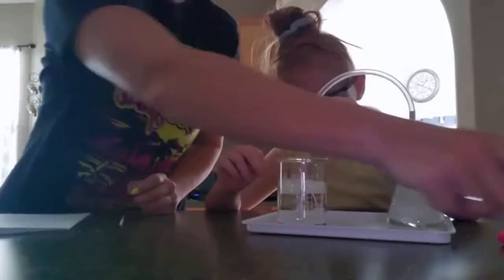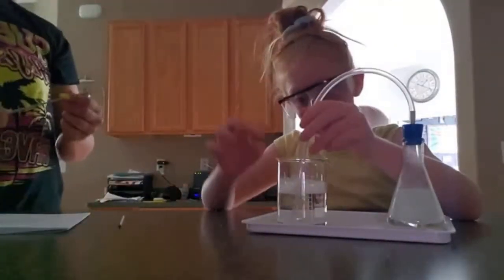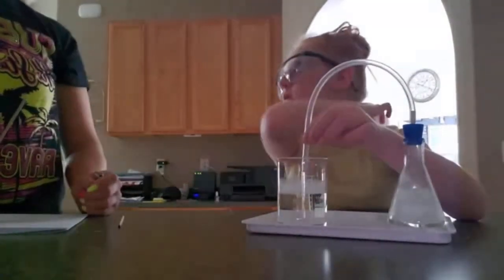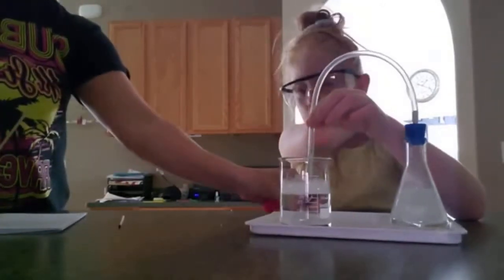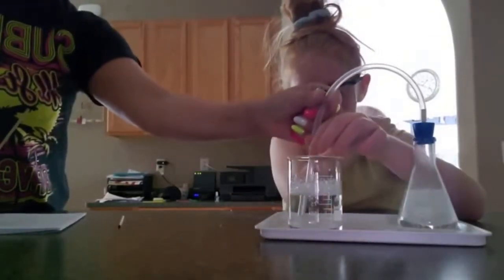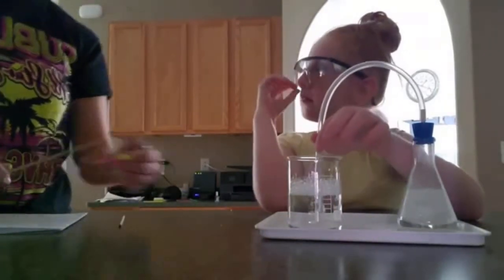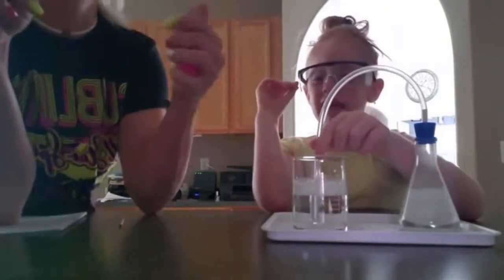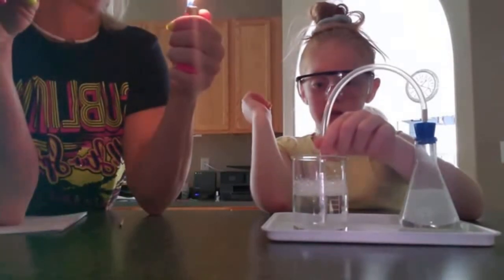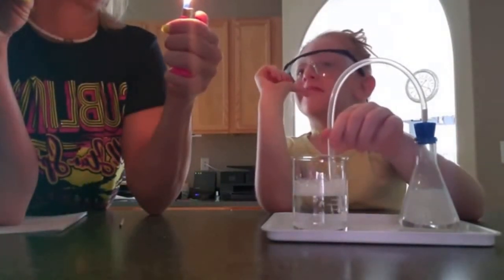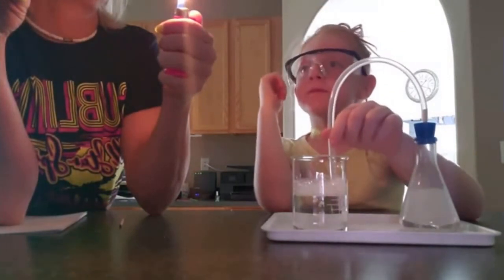What does it look like is starting to form on top of the water in our beaker? Foam! So when it's time for us to actually light it, Toby, you're gonna take the tube out, and it warns us we might hear like a noise, a pop or a bang. So let's listen and see if we can hear anything like that. I'll tell you when to take it out. You can plug your ears if you want to. Just wait until you take the tube out.